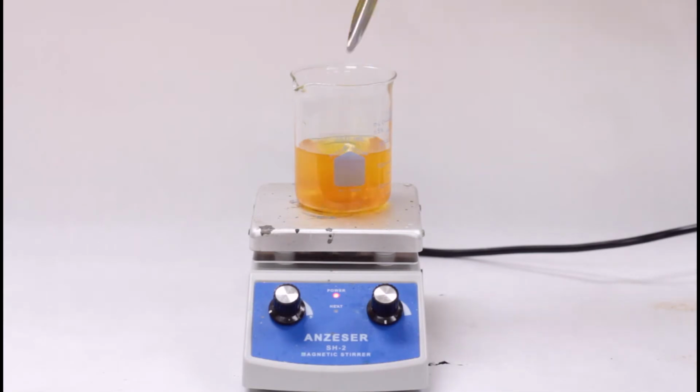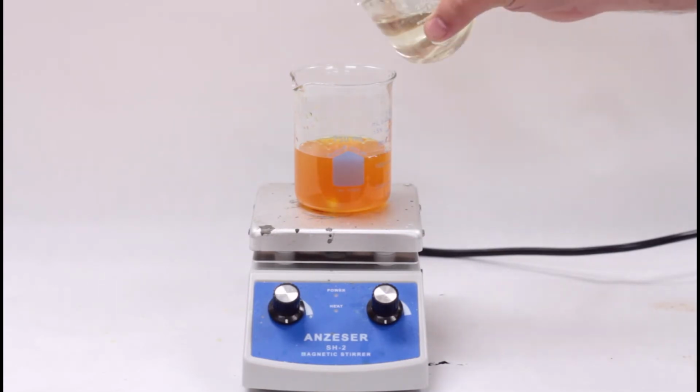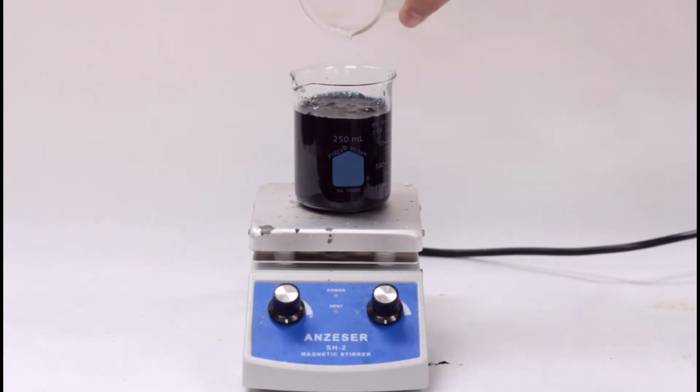Do some research on each type of mixture and the Tyndall effect, and then in your lab report identify whether each mixture has the Tyndall effect, whether it separates on standing or not, and then classify it as a solution, colloid, suspension, or emulsion. This should be in the data section of the lab, and it should be in a data table.